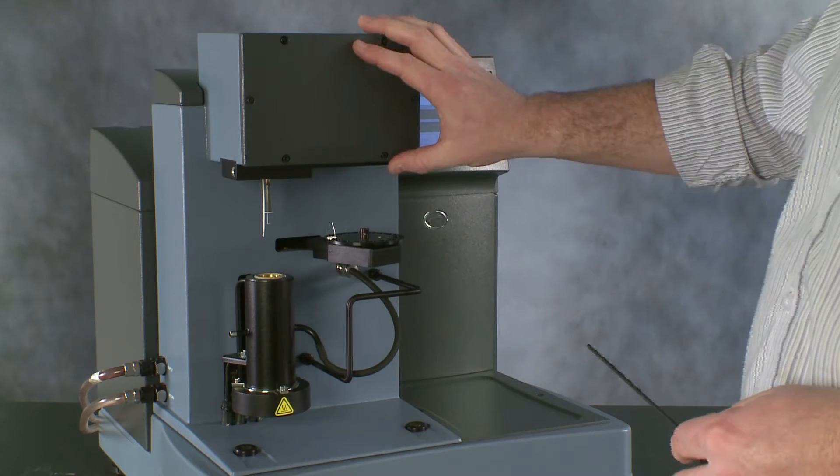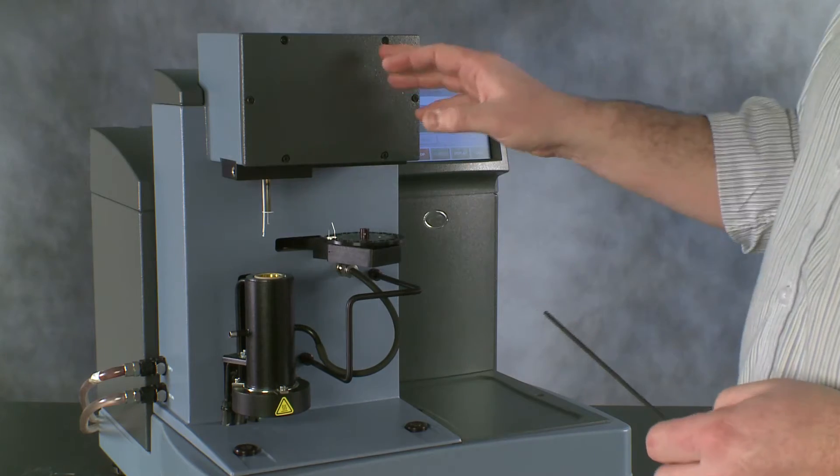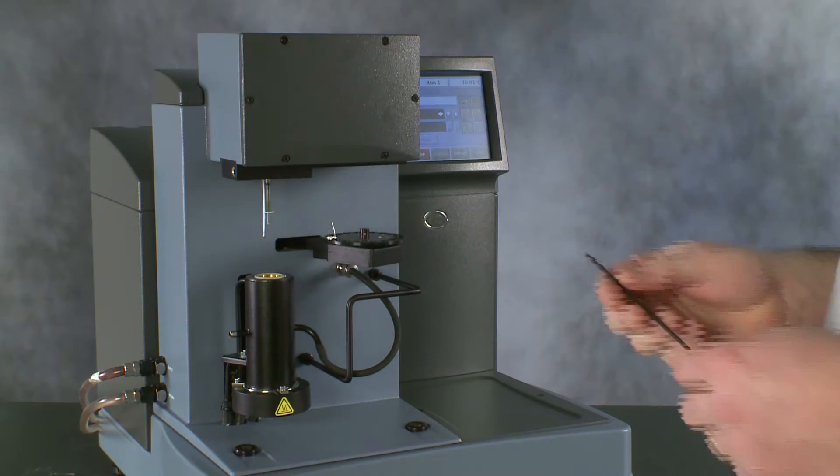These are captive to the cover, so they won't fall out for us, but we need to make sure that when we're at the sixth screw, we're holding on to the cover so it doesn't drop off.